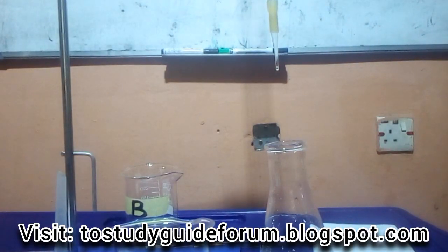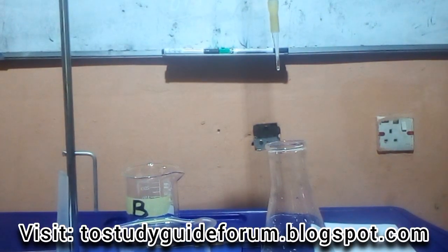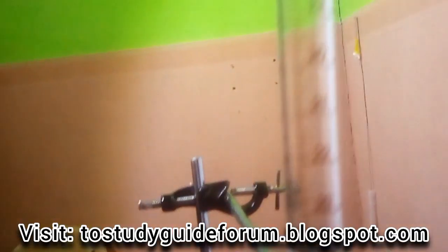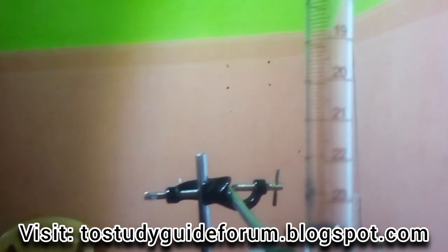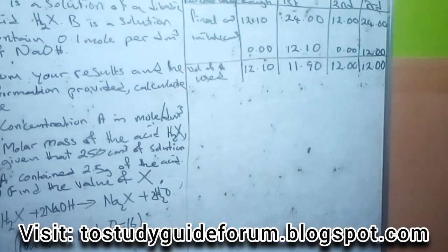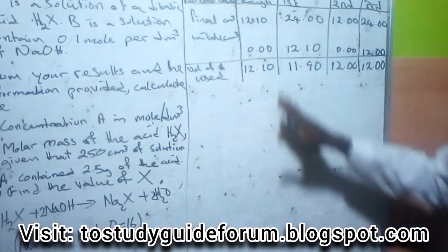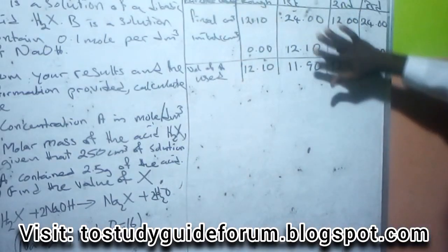My initial is 12.1. I need to bring this camera. You can see now it's at 24. So this is the outcome of our titration. So these are the readings, the final down to the end.